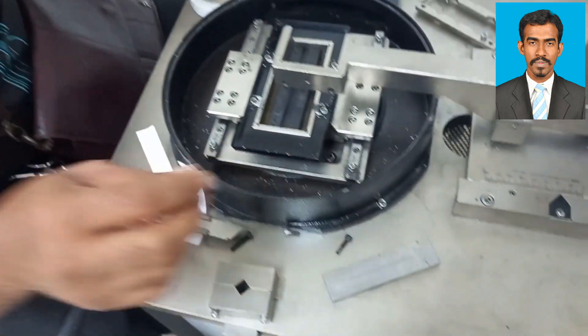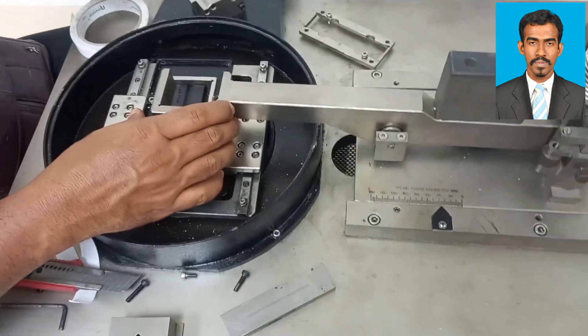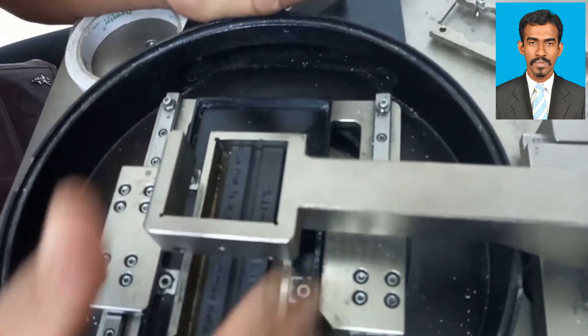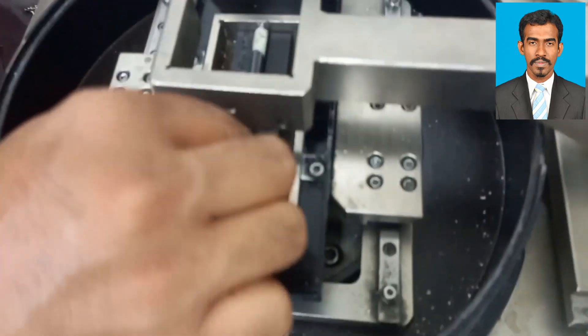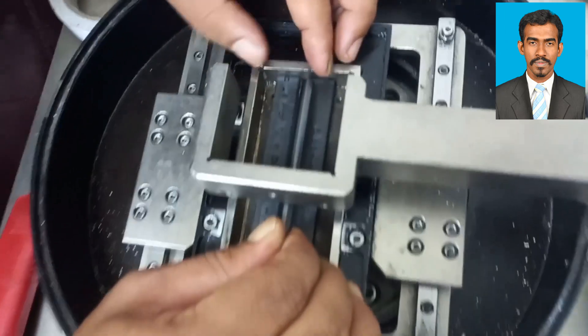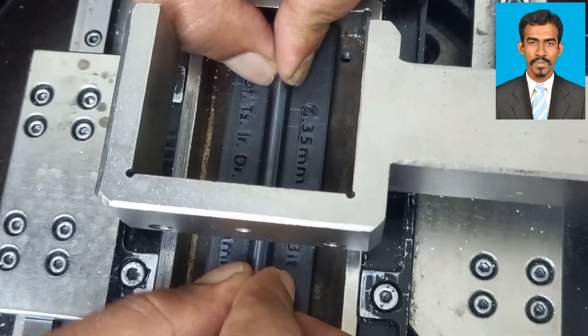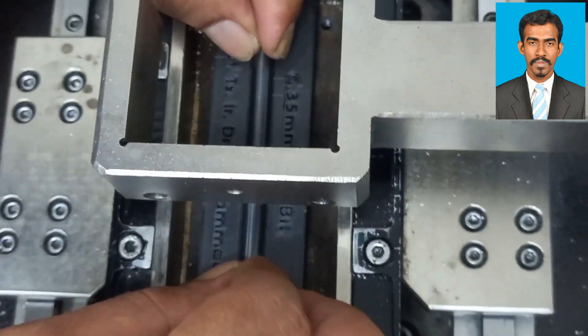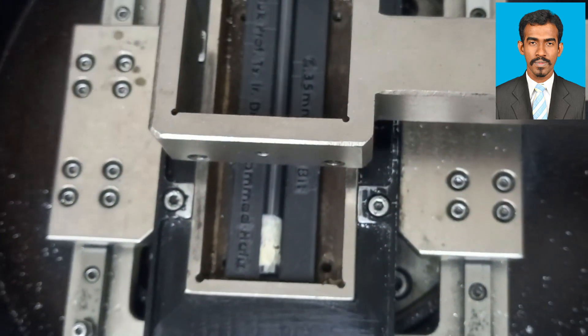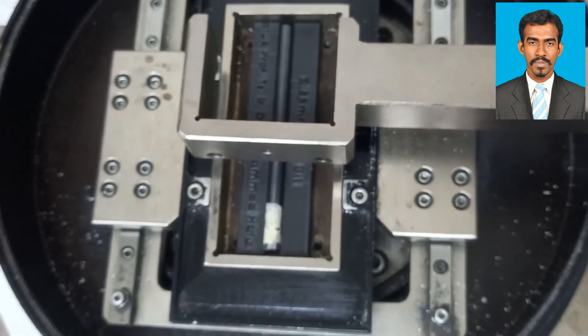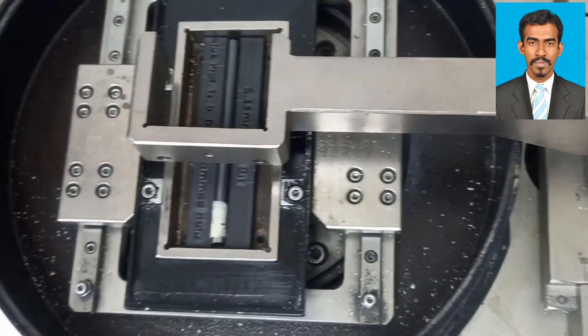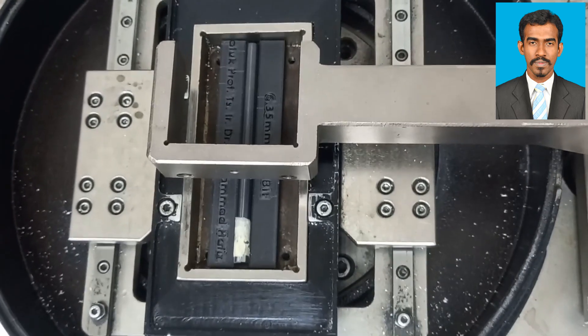Before fixing the ball on its location, the specimen will be fixed on the specimen holder. It is highly preferred that the length of the specimen and the length provided on the specimen holder are equal. For this particular reason, the specimen holder is designed for this job. We didn't use the specimen holder which comes along with this machine.